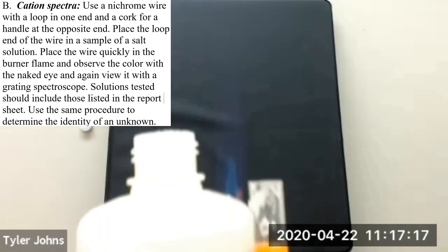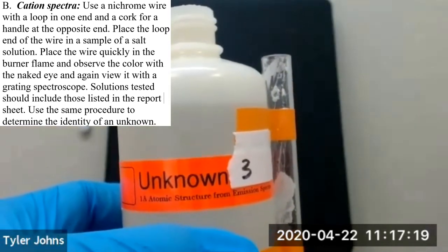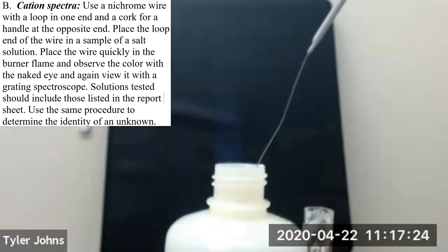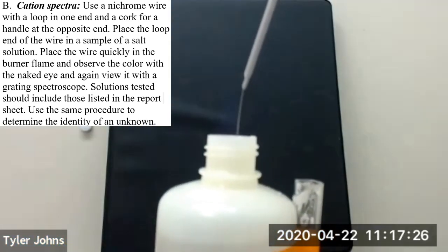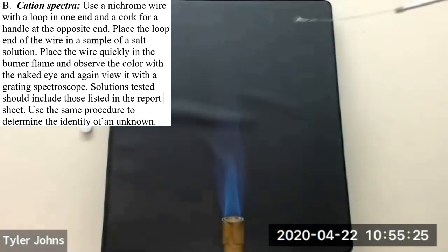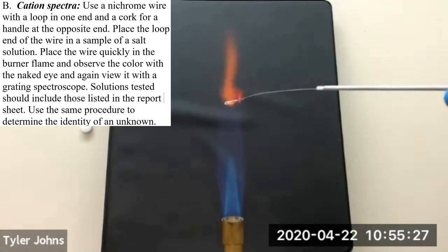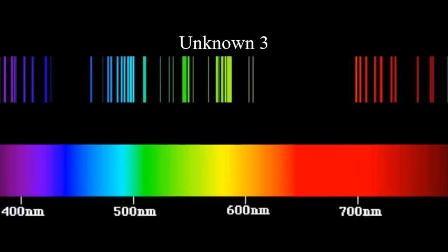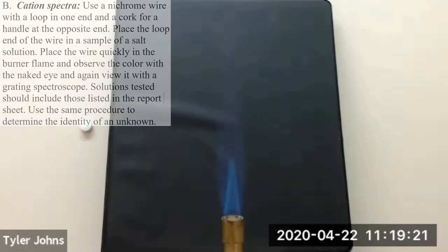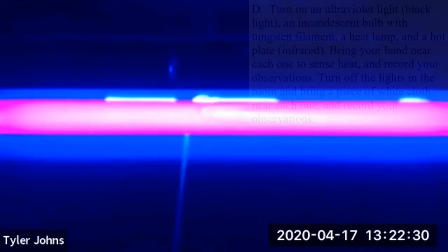And now we'll look at our third unknown cation spectra. So this is unknown number 3. Insert our nichrome wire, and we'll place our nichrome wire in the flame. You will now need to determine what our unknown cations were.